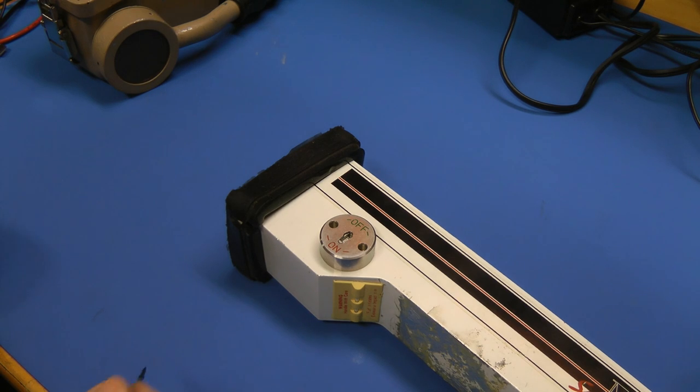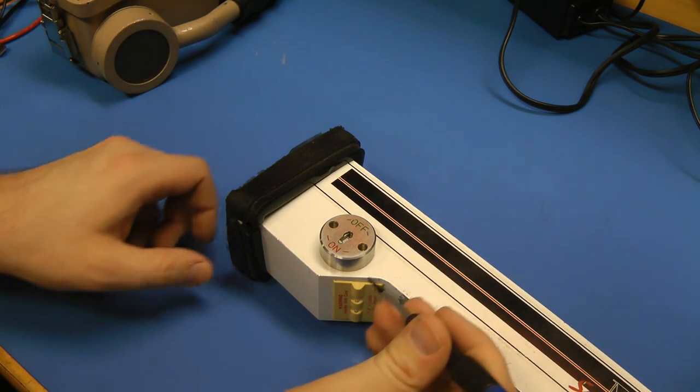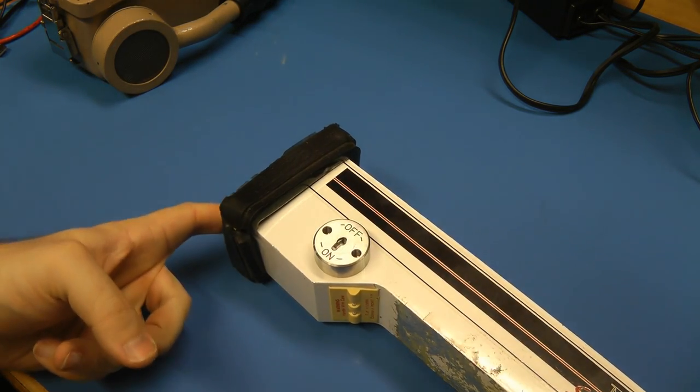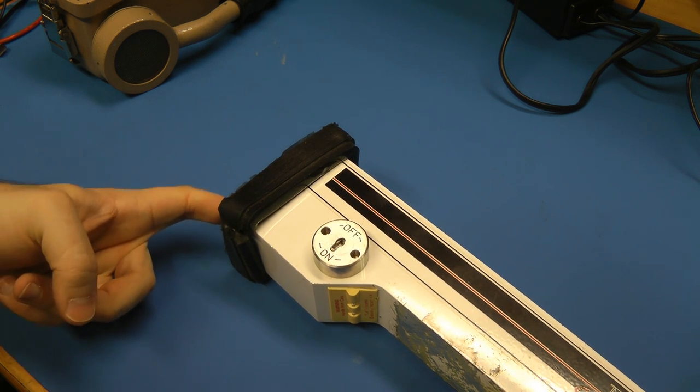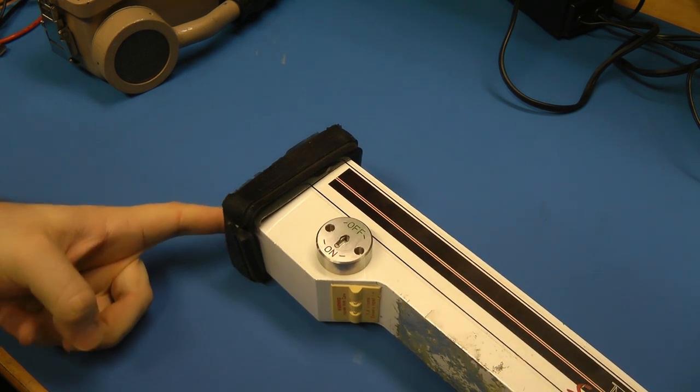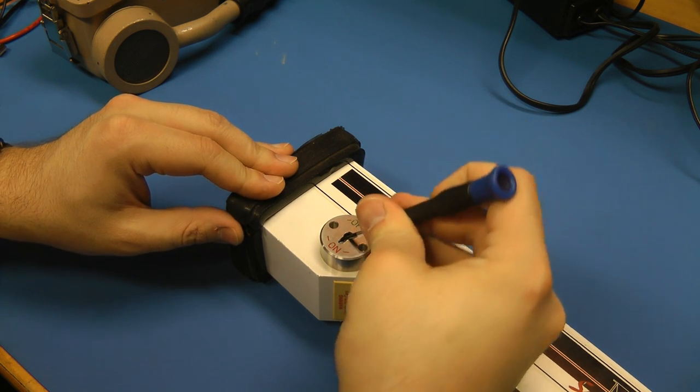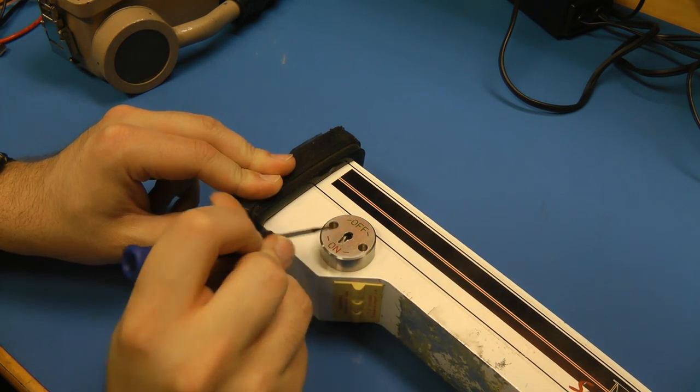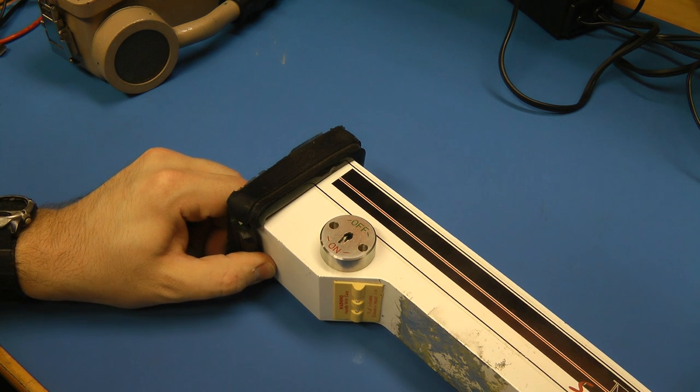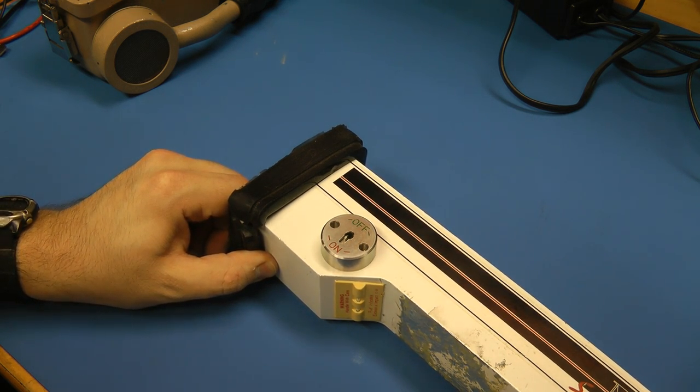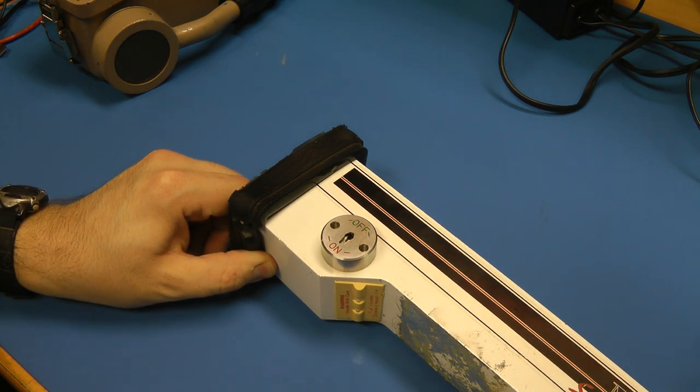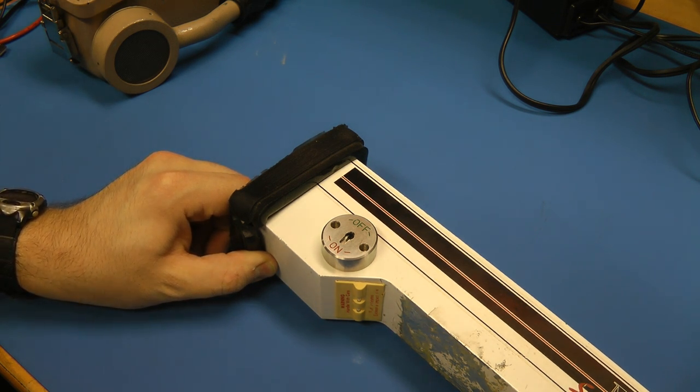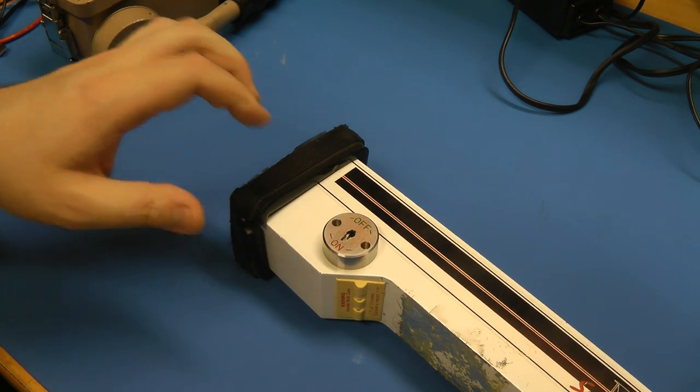Let's see if we can test if the source is in this thing. So just pushing the ground contact probe doesn't seem to change anything. We're still just getting background. I figured this lock is actually pretty easy to defeat just by turning it around. Even then, when I push the probe, we don't hear anything beyond just the background on this.